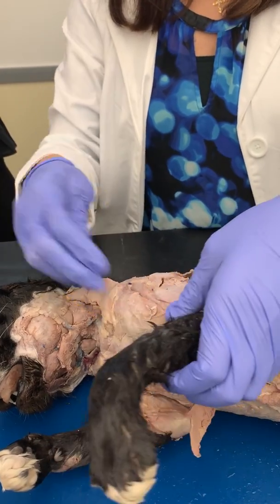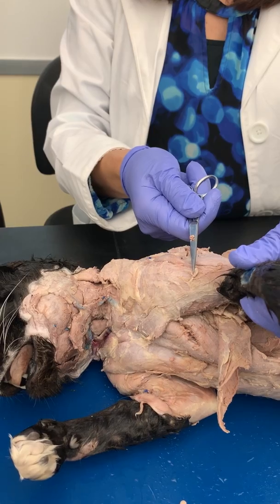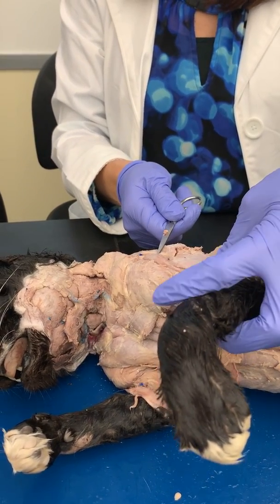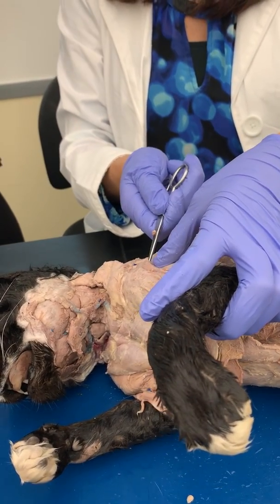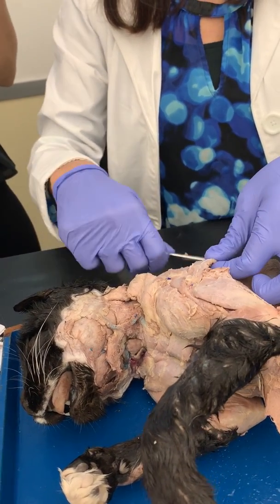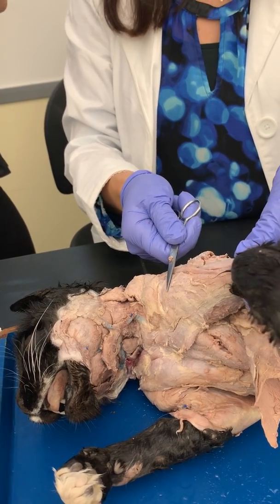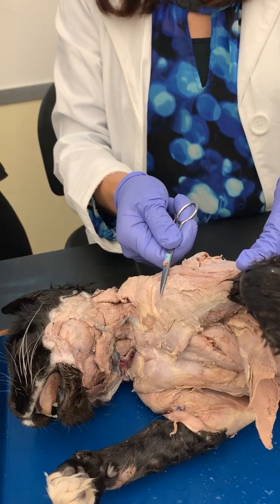Then deltoids. The deltoid is the shoulder region. You have three deltoids. This is, let me make sure. So you have the acromial. That's this little one right here. That's your acromial deltoid. This guy right here is your spinous deltoid. And then this guy right here, it kind of looks like your bicep, but it's not. This is your clavodeltoid.